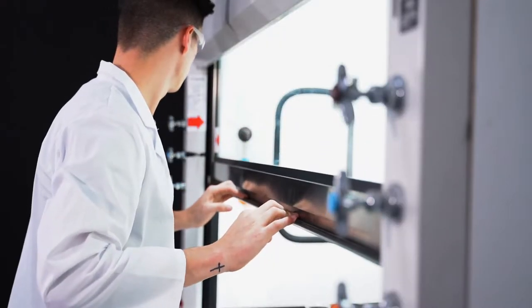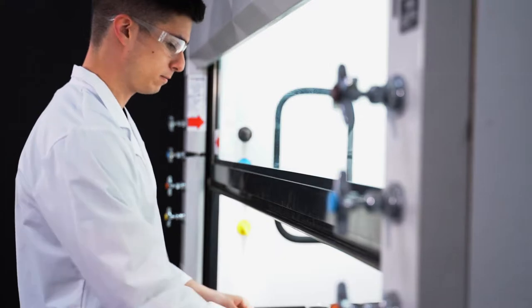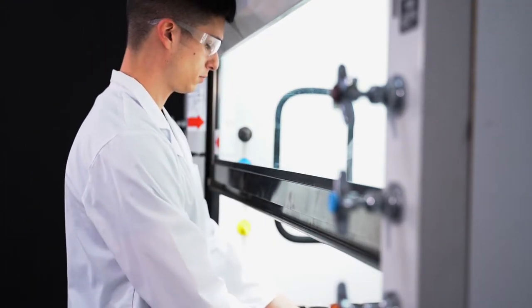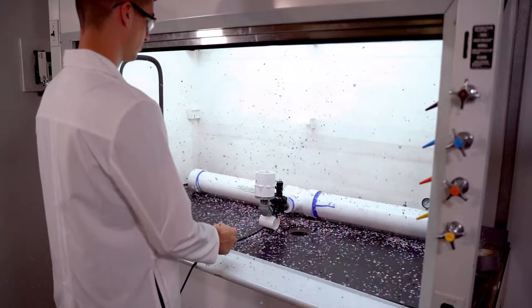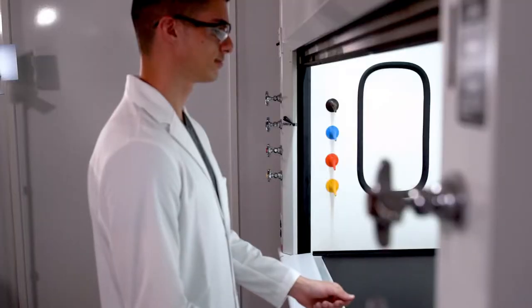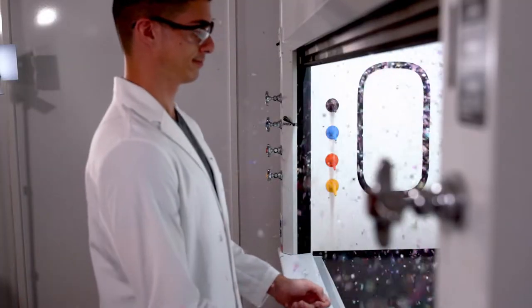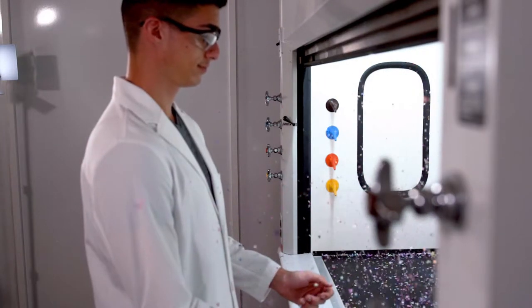Explosions, procedure splashes, or sprays will hit the inside of the sash rather than the user. In this simulated explosion, with the sash fully open, you can see debris and particles hit the user's hands, face, and chest. Keeping the sash lowered is far safer.